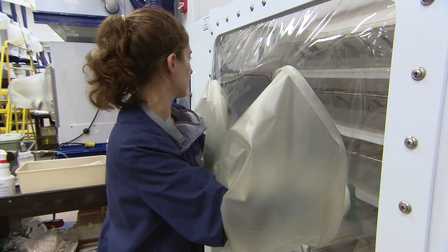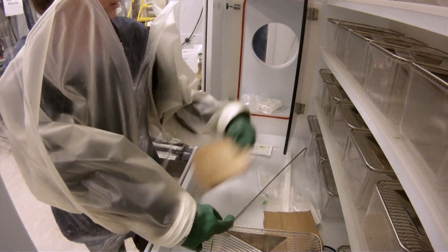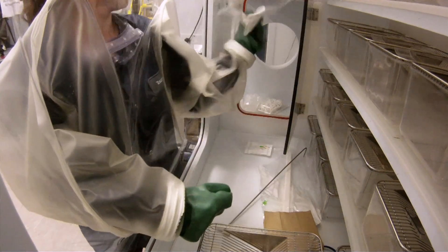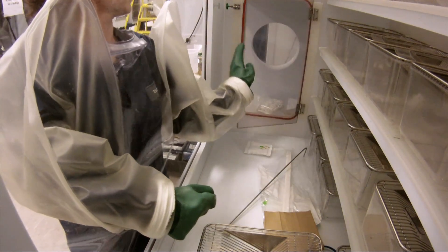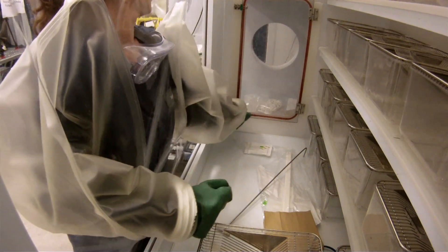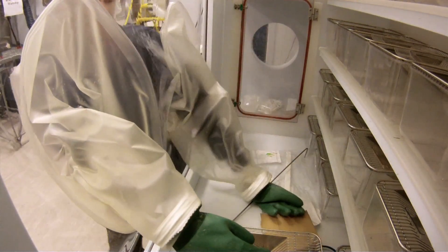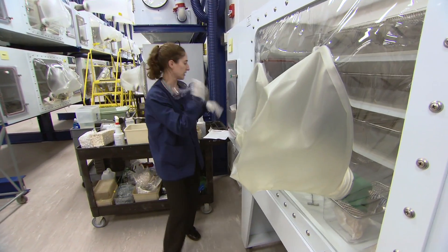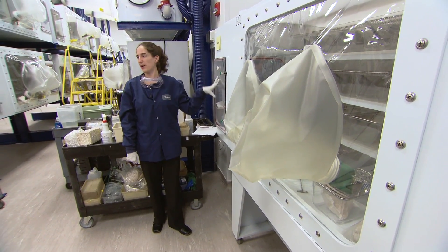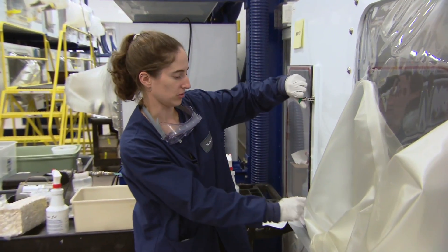To get things out, it's just kind of the opposite. You open the inner port door first after ensuring your port is sterilized, then push all your dirty supplies out. There are two clamps to shut on the door to make sure it's locked. When it's out, you can pull your supplies out. If you're using this as a quarantine isolator you might need to spray out your garbage, but if this is a germ-free project all the trash and supplies could just come right out.